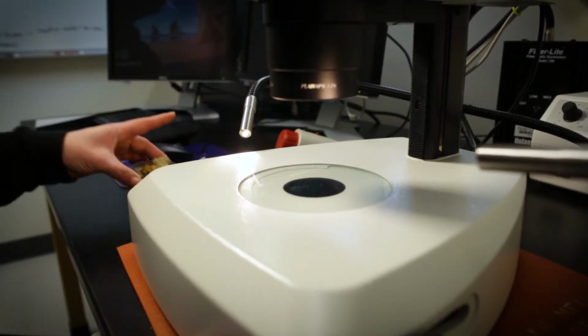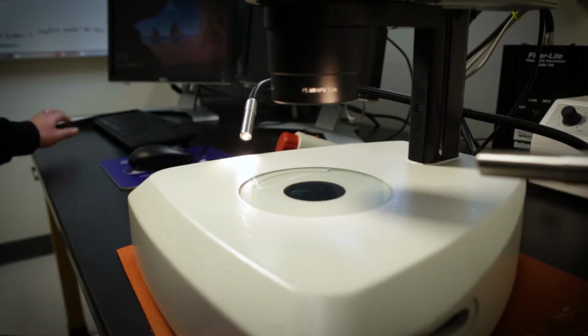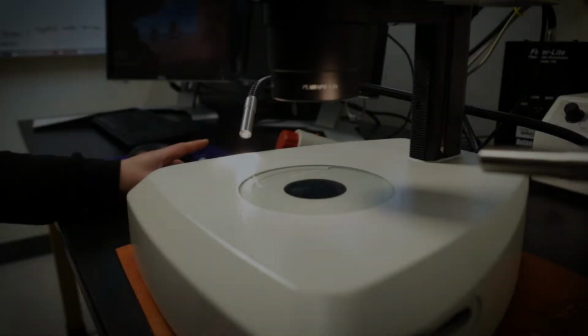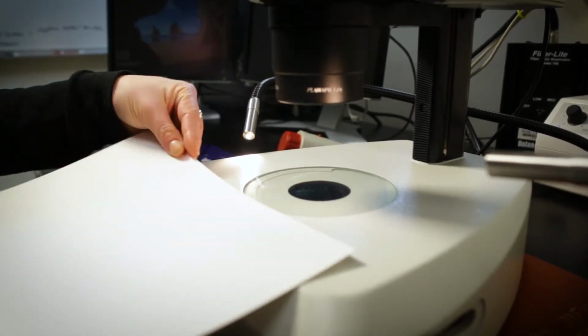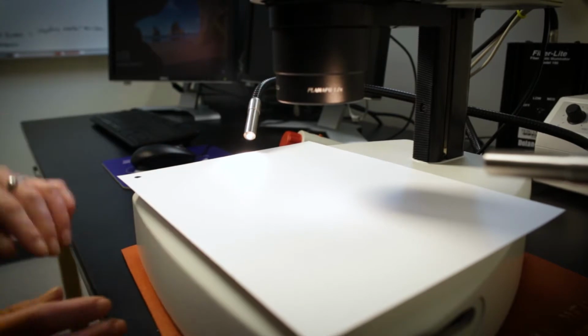Now, carefully remove your sample from the microscope stage and set it aside momentarily. There are special white cards used to calibrate white balance available in room 67C. Take one of these cards and, without changing the Z-stack height, zoom level, or lighting, place it on the stage of the microscope. Look at the software.